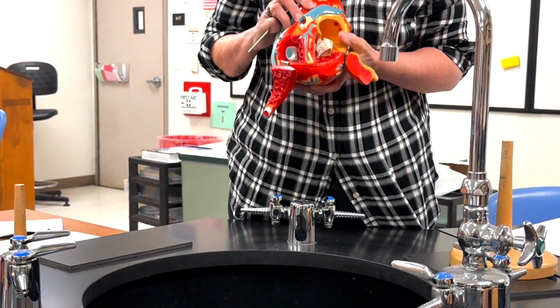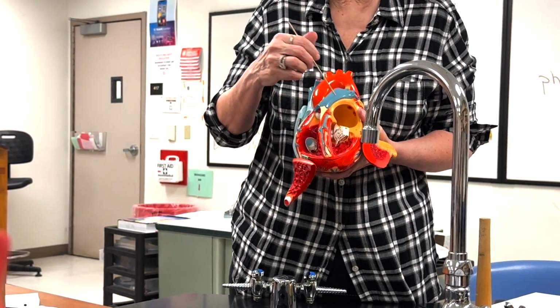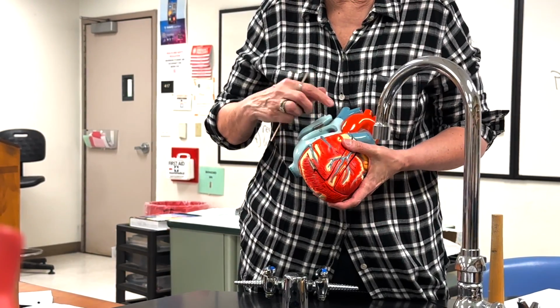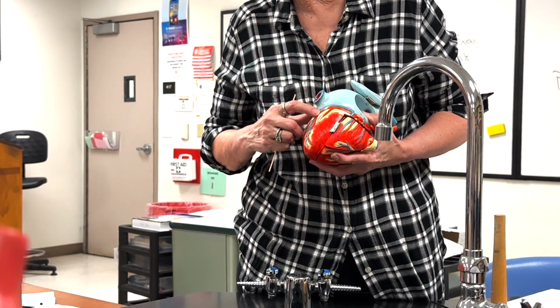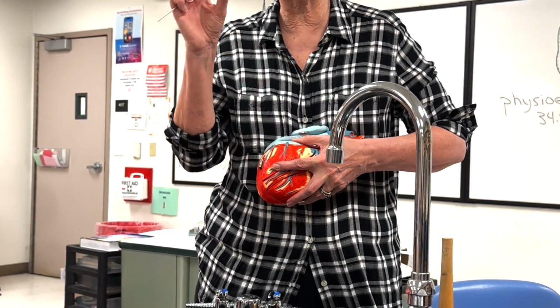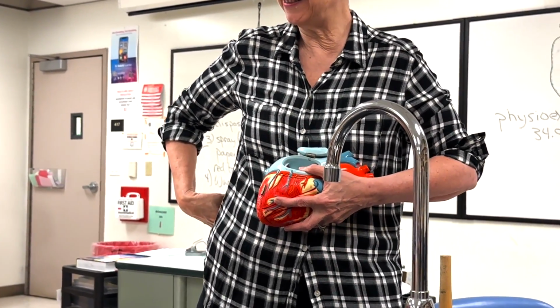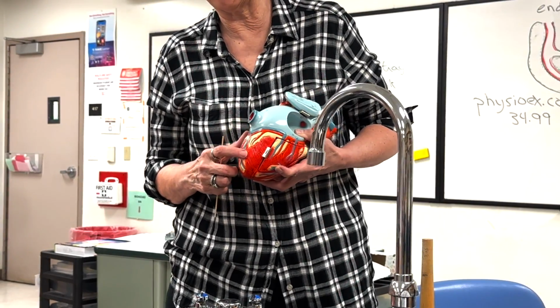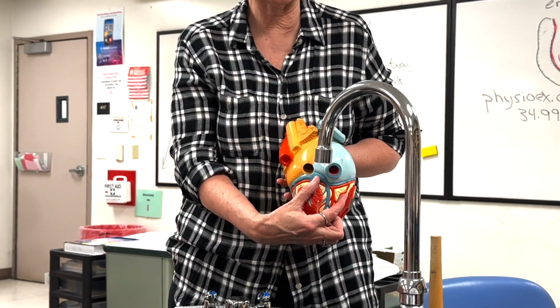Now, when it leaves the aorta, we have the right coronary artery and the left. Those are the first two vessels to come off of the heart. And so the right coronary artery goes all the way around between the atria and the ventricles, and it gives off the posterior interventricular artery. On the side here, it gives off the marginal. So I want you to know right and left, and then two branches for each. So right coronary artery kind of swings around like a belt. At the side, the hip, it gives off the marginal. And at the very back, it gives off the posterior interventricular. Between the right and left ventricles, it's a good way to separate those two ventricles, okay?